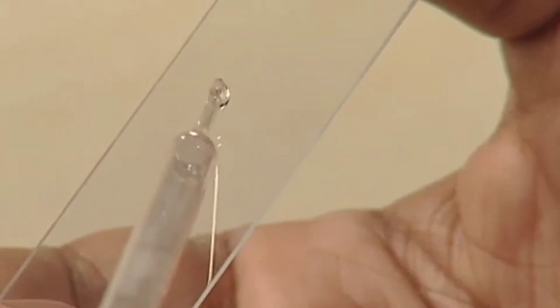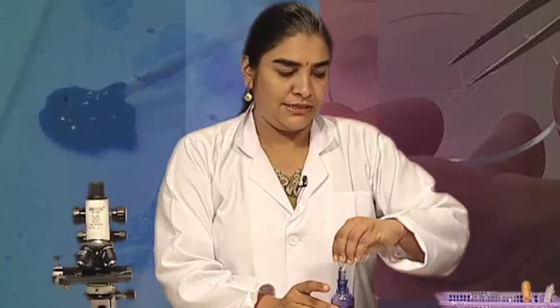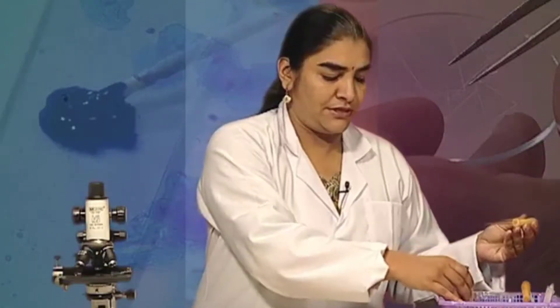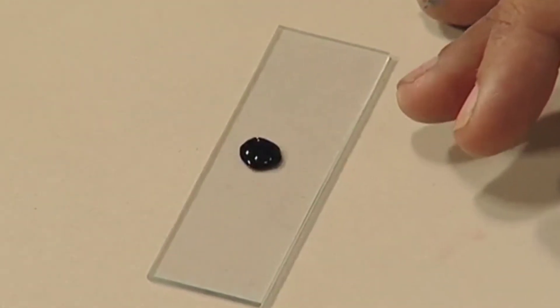Let us see how we are going to make the temporary mount of cheek epithelial cells. First, take a slide and in the center of the slide, put a drop of water. Now, take the stain and add a drop of the stain in the center of the slide where we had put the drop of water.